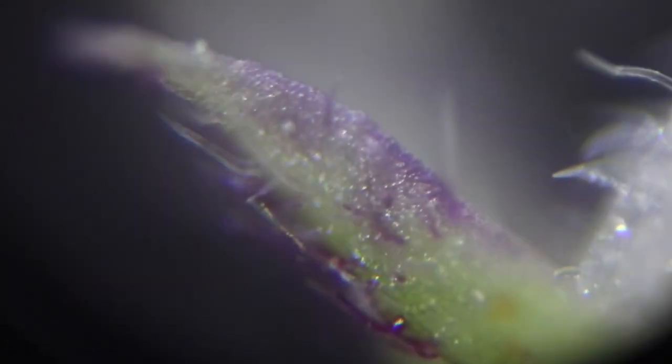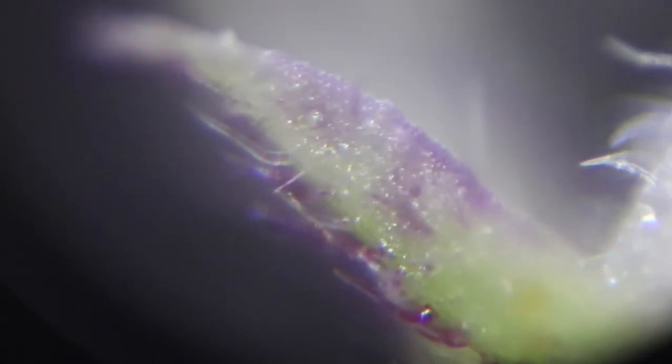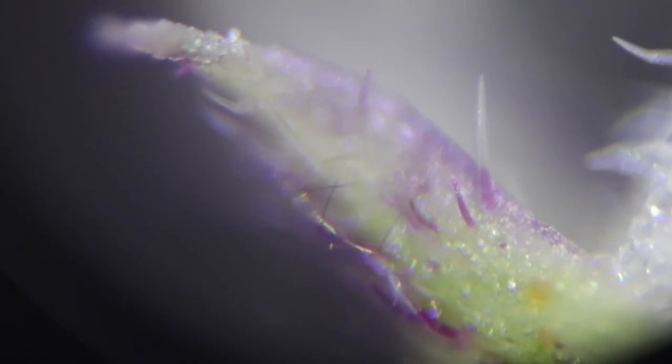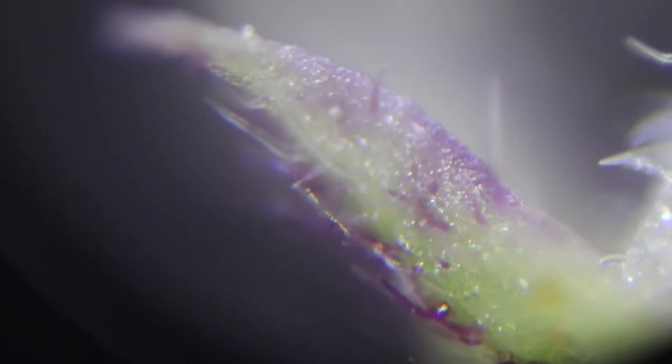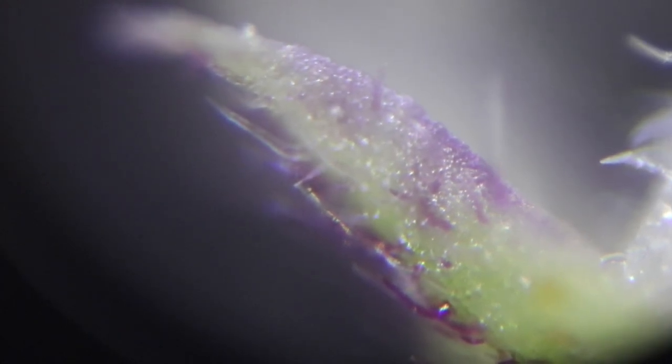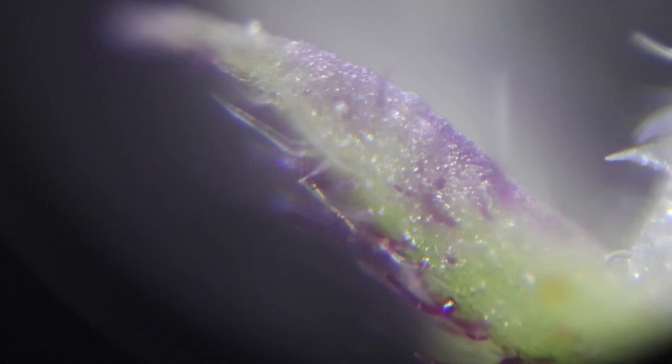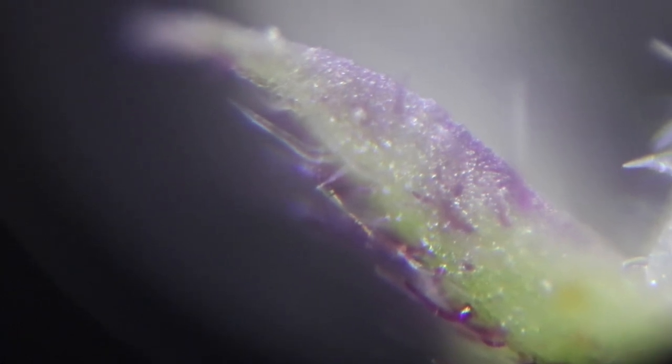Moving this around a little, sorry about that. It's backwards in how you move things on a microscope, and so it's a little tricky. Okay, I'm gonna work on bringing that into focus. It also has a very small range of focus under this level of magnification, so not everything will be in focus. The large pictures that you see that have everything in focus from a microscope are layered pictures, where they're bringing each piece, each plane, into focus and then layering those pictures to get a clear picture.